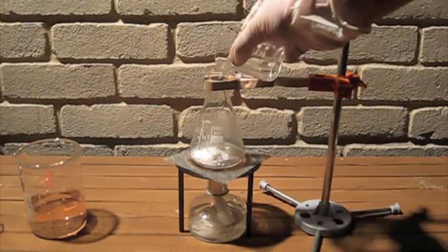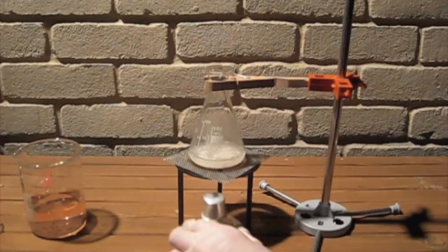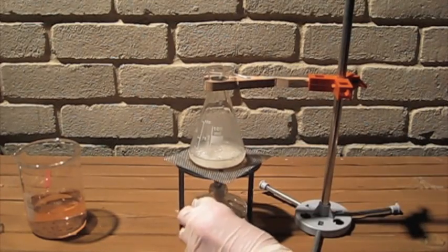Now I'm going to add a small amount of water to dissolve the chemicals and heat the solution.